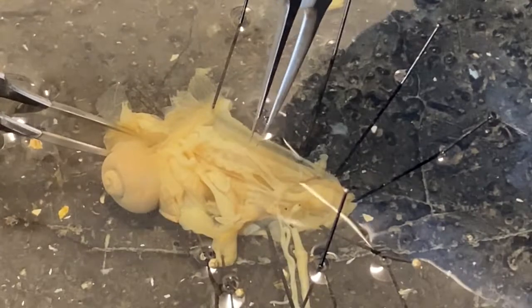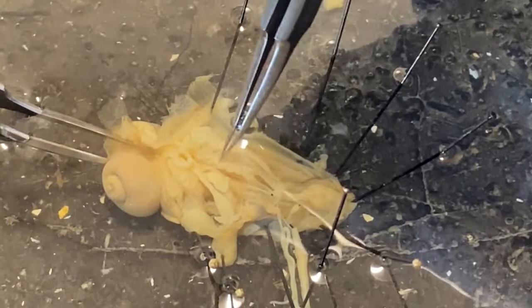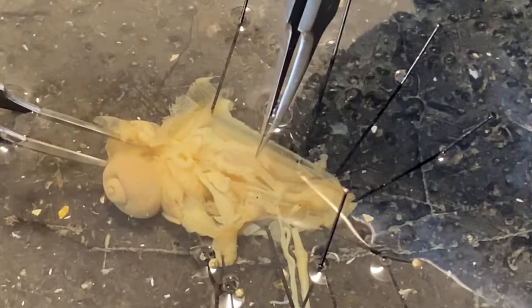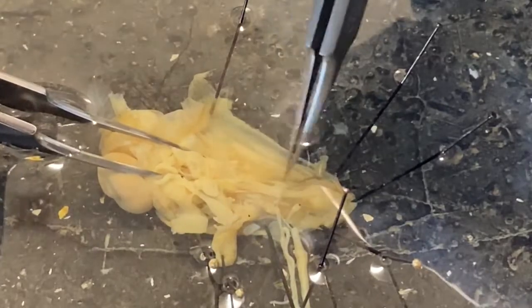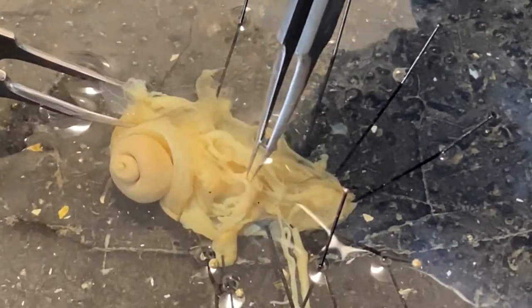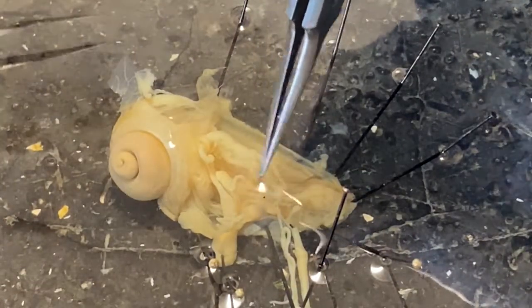This structure right here is the crop, and you can see that's a salivary gland going along one side of the crop — if we could roll it over, we'd see another one on the other side. All the other stuff underneath it are muscles of the foot. And this little bulb right here is the copulatory bursa.